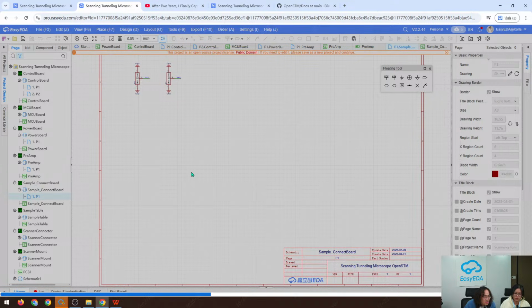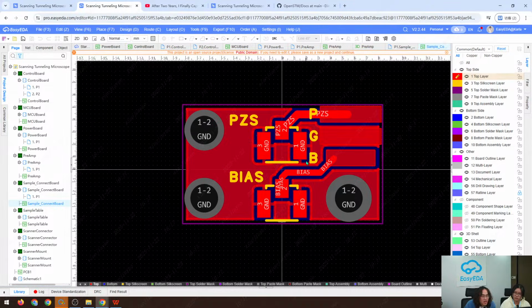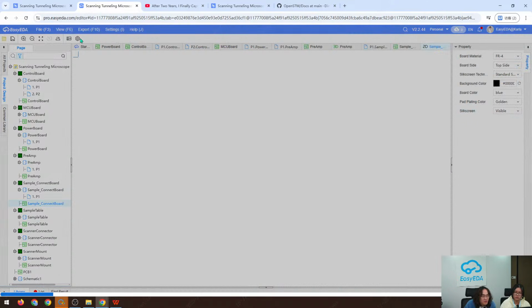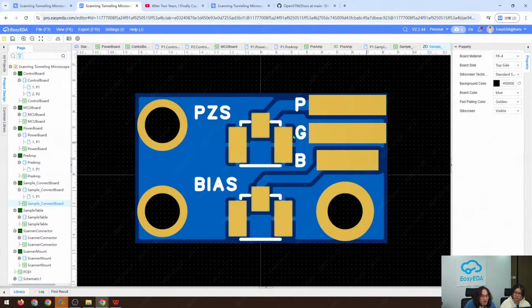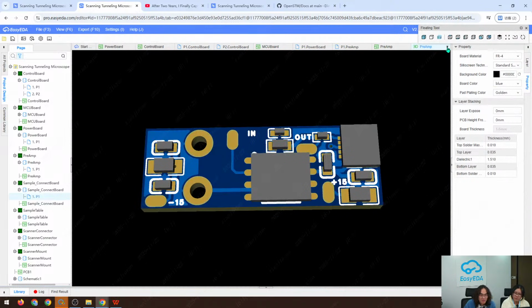And this is the connect board, just to connect the signal between the control board here, the sample and the piezo sliders. Yeah, just a connect board to transfer the connection.